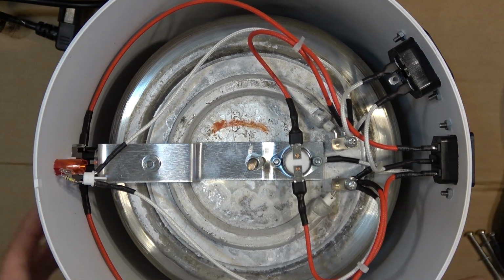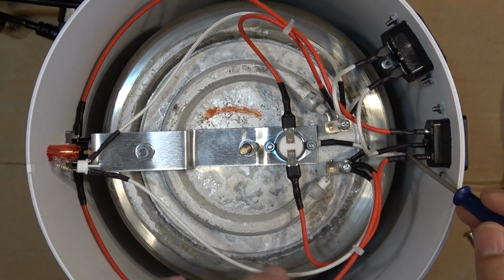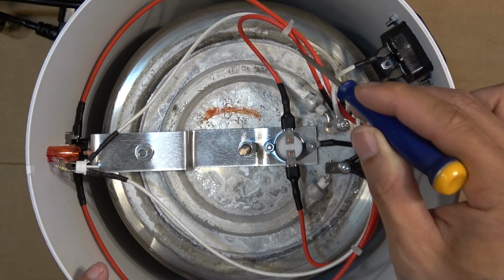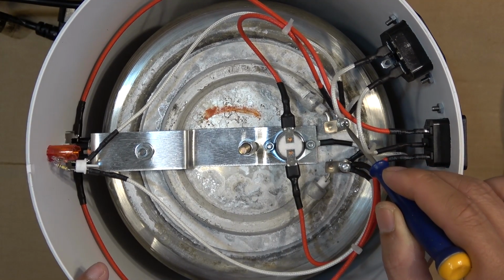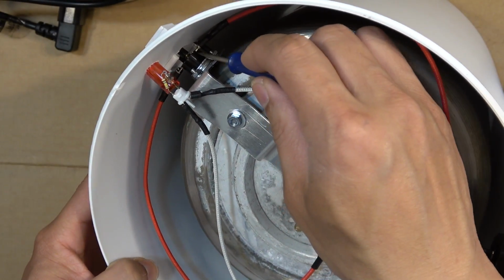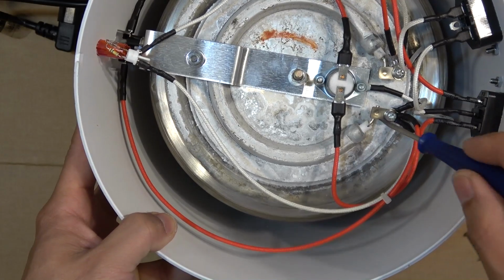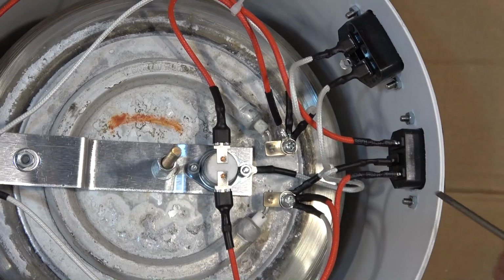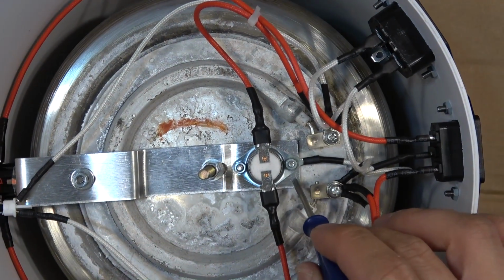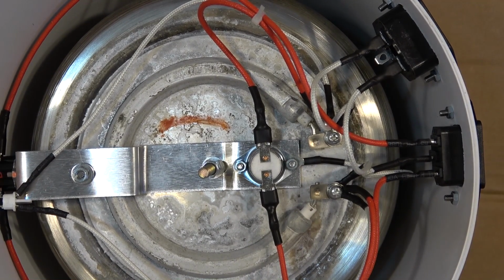It's very, very simple. So the power comes in here, goes in on this side. It goes straight to the heat sensor and then out to this end of the heating element. The other wire goes out to the other heat sensor power switch down here. And then that wire goes out back to the other side of the heating element. The third wire, which is the white wire, goes down and is mounted onto this metal plate, which is mounted onto the bottom of the pot, so it's properly grounded.